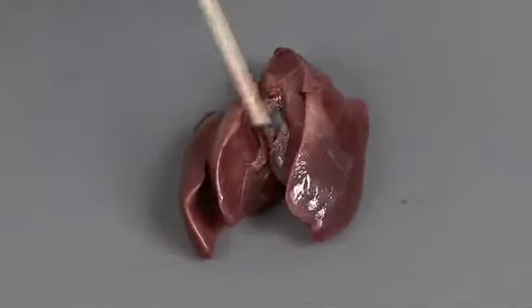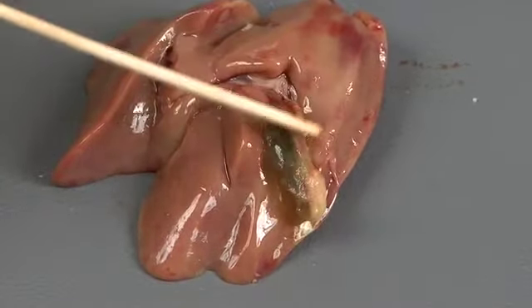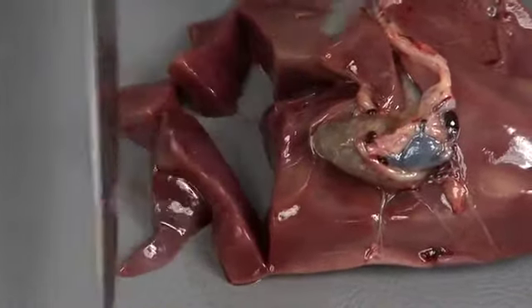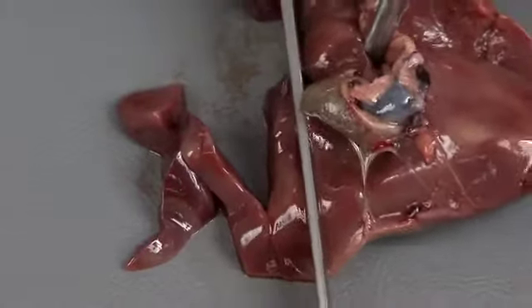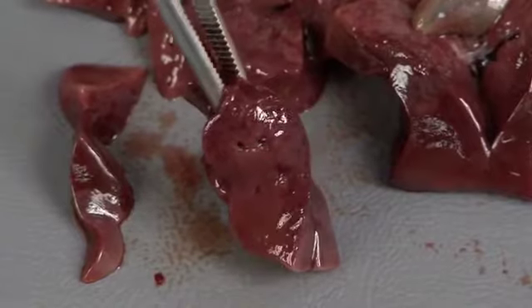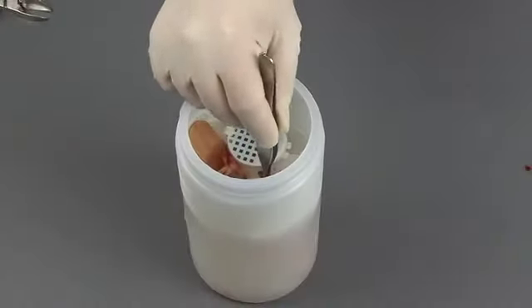Examine the outer surface of the liver. Remember, bile imbibition may cause bile to leak from the gallbladder and stain the surrounding liver yellow or green. Using a blade, make a series of parallel cuts, 1/4 centimeter thick, through the liver tissue. Pay attention to the consistency and texture of the tissue. Focal or regional changes may indicate a lesion. As you make the cuts, it's normal for a small amount of blood to ooze from the liver. Examine the cut surfaces closely. Select any lesions, along with 1 or 2 areas from each lobe, to collect for histopathology and place them in formalin.